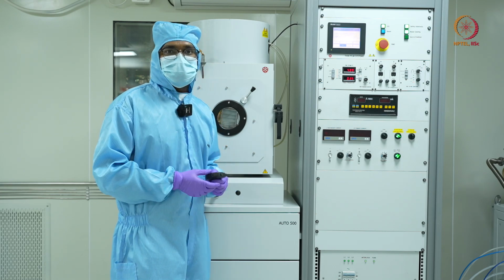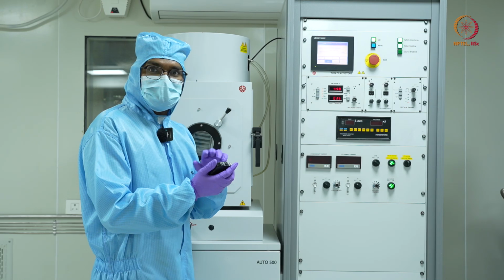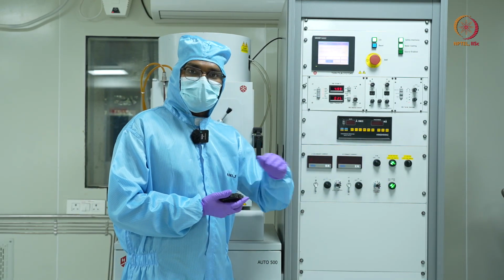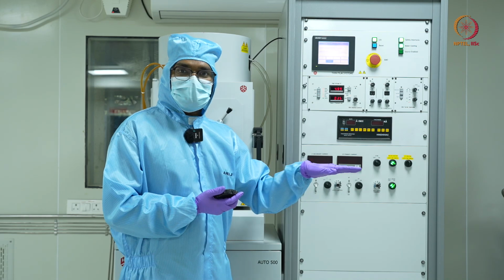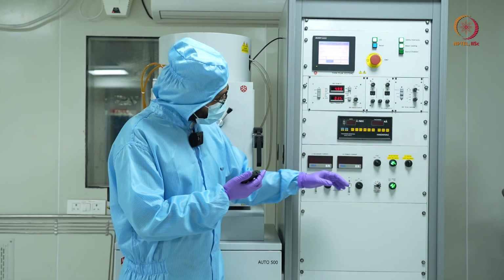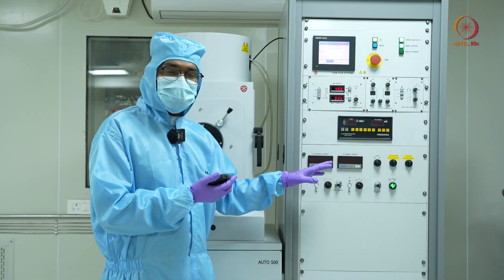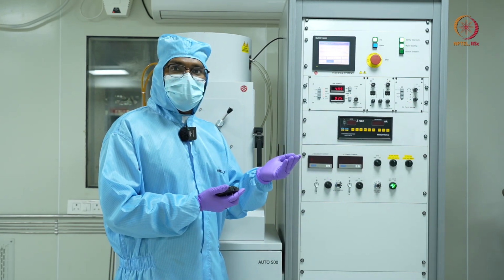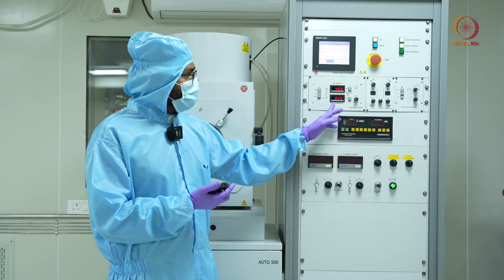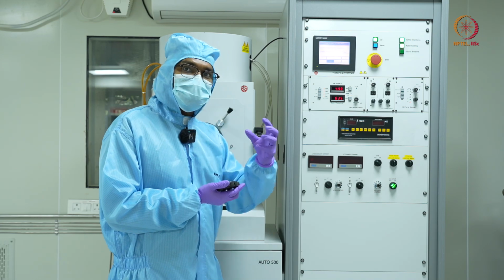Once we are done with a deposition of 10 minutes, we will continue. So now it has been almost 10 minutes. As soon as I hit the 10-minute mark, I'll be closing off the shutter, so that exactly at 10 minutes my deposition will stop. Okay, now it has been 10 minutes. I've closed the shutter, the deposition has stopped. Meanwhile, the rotation is still going on, and the electron beam is still falling on my source material. So it is still evaporating.